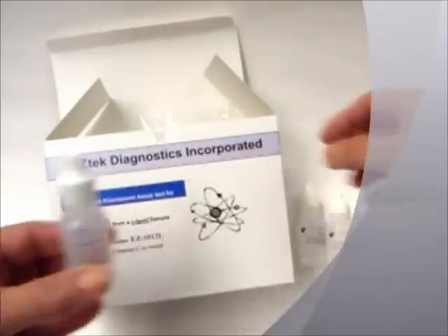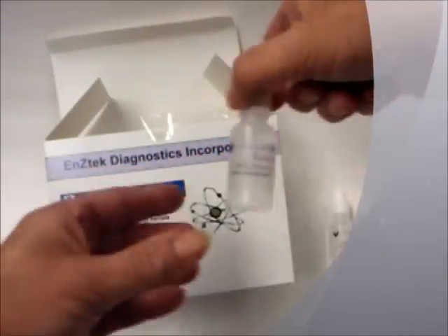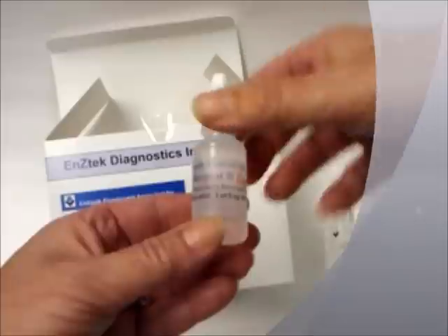There is a bottle of Reagent B, which is an enzyme inducer and helps trick the bacterial cell into producing more enzymes.